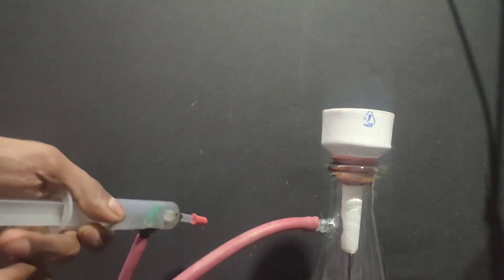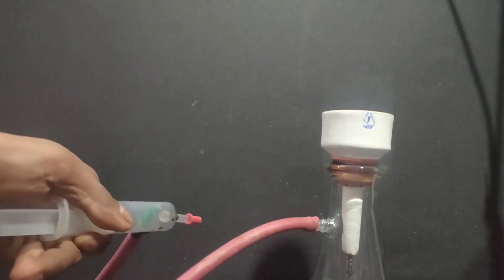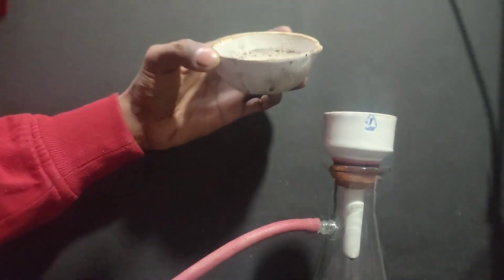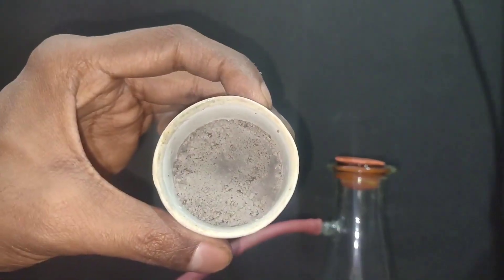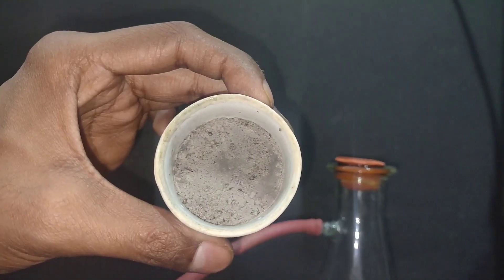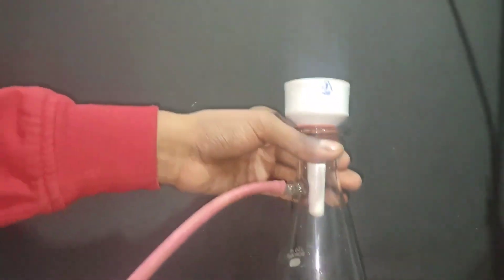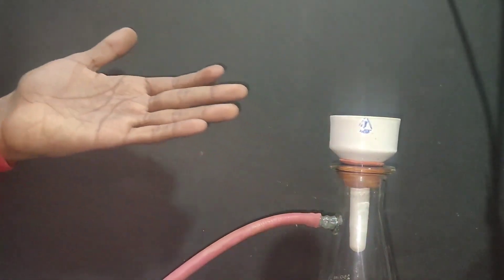I then filtered the crystals on my Buchner funnel with vacuum filtration and pulled out all the water. Then I washed the crystals with distilled water, but still the crystals were grey. The filtrate was black. I kept it to extract iodine from it.